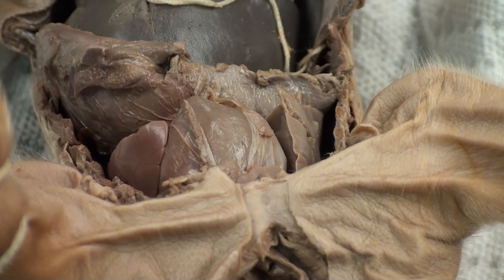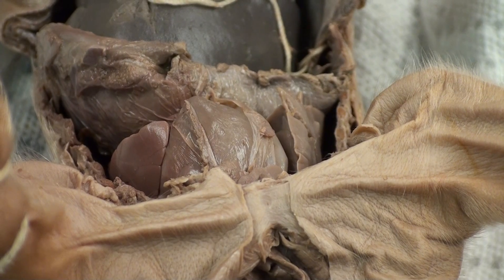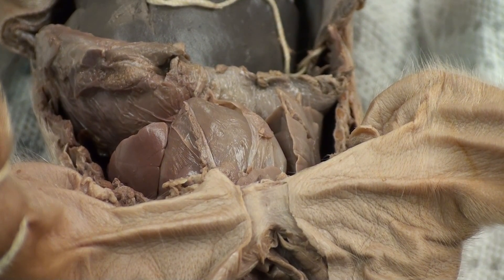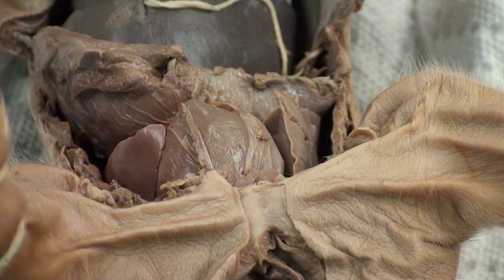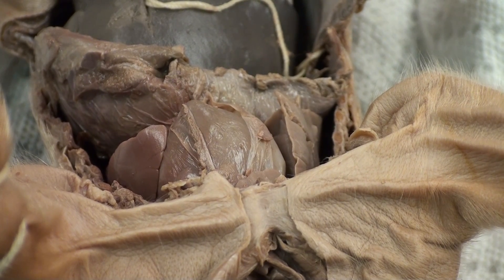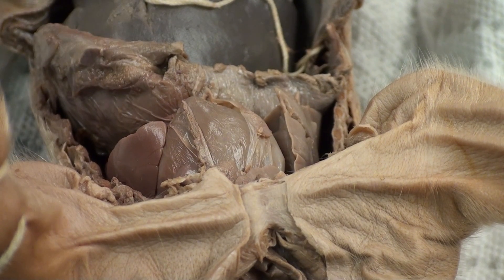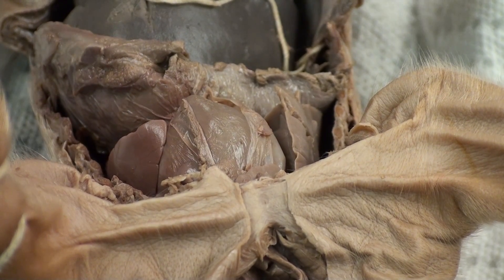The lungs' main purpose is for gas exchange to occur. In gas exchange, oxygen diffuses through the capillary walls into the bloodstream, and carbon dioxide in the bloodstream diffuses through the capillary walls into the alveoli, which you then exhale.